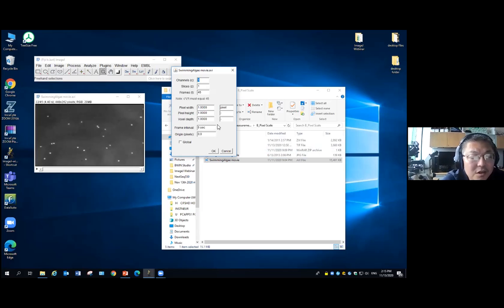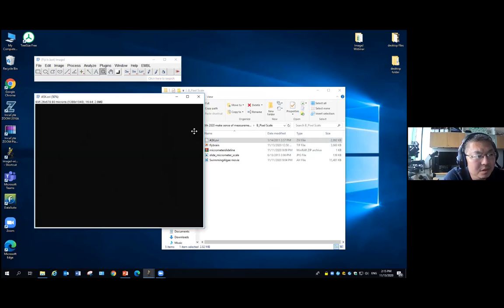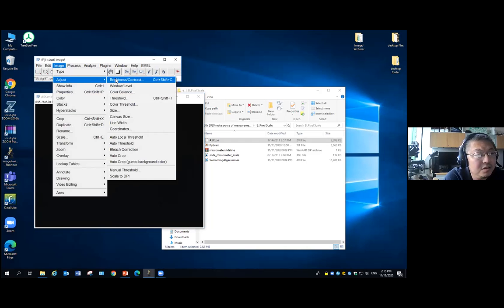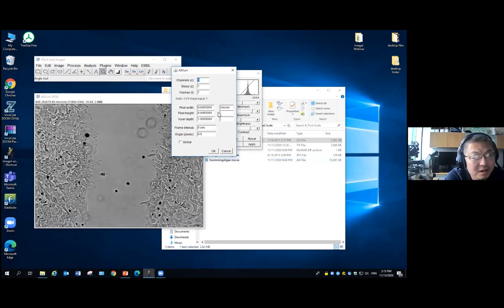Okay. So you need to make sure at the beginning, when you process your image, it's always good, you find the raw image, you open it in ImageJ, and you just double check. What is the pixel scale? Let's say it goes to this one. This is my image. I check the pixel scale. Does this make sense? Just double check with the acquisition software to make sure everything is fine. ImageJ can read the pixel scale very well, okay? And then we begin to do all the processing.